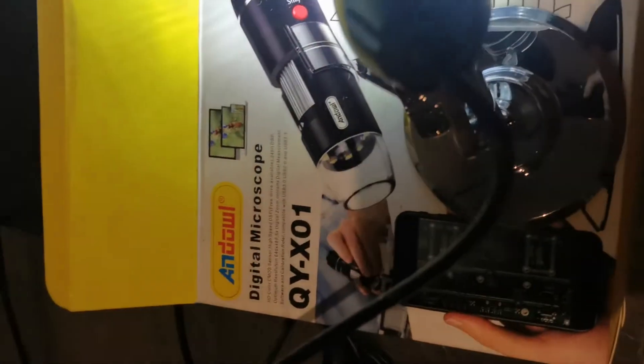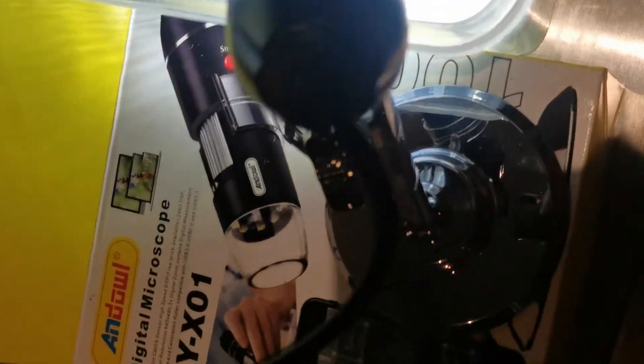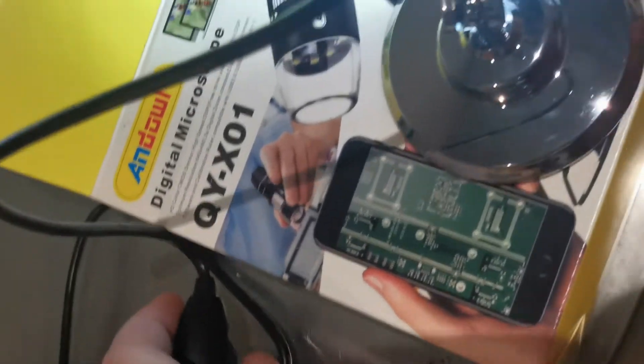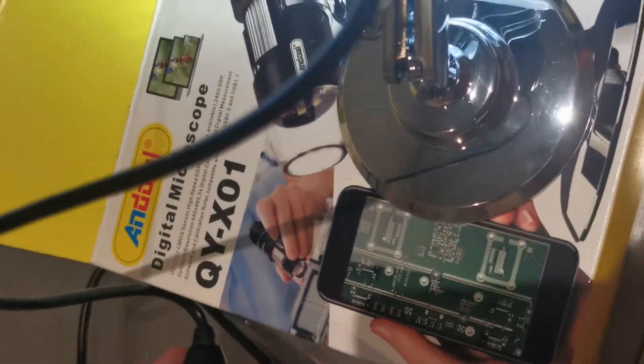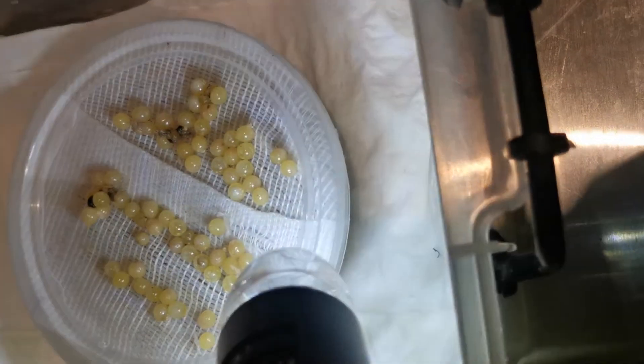Just what it looks like. You can get it from a lot of places. Mine came from Take-a-Lot. This is to set the light. I'll show you here, you can set it however bright or dim you want.